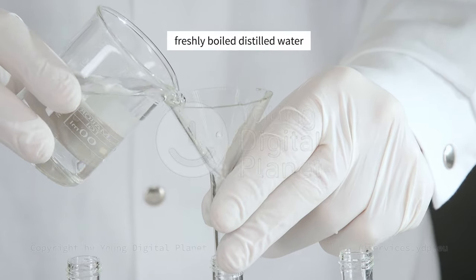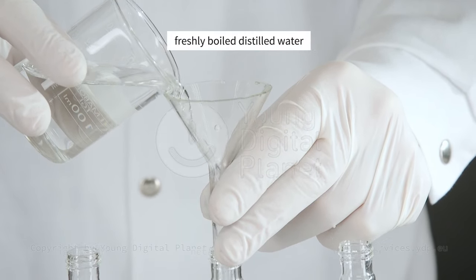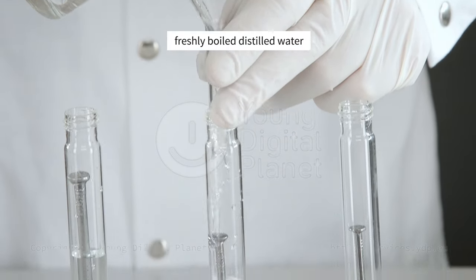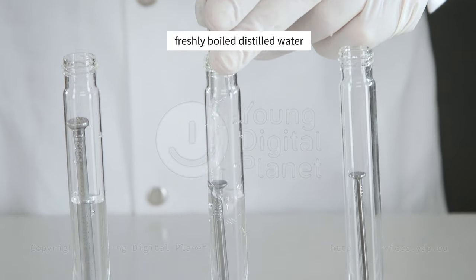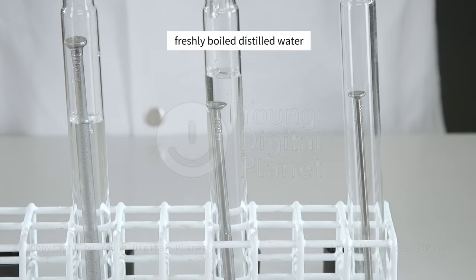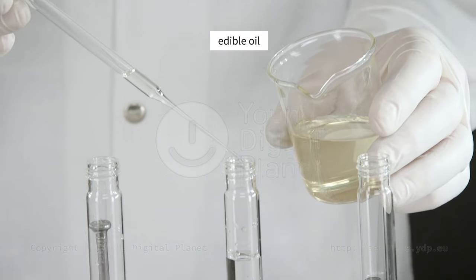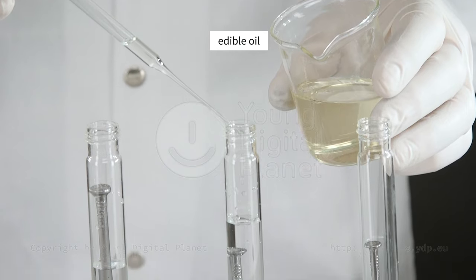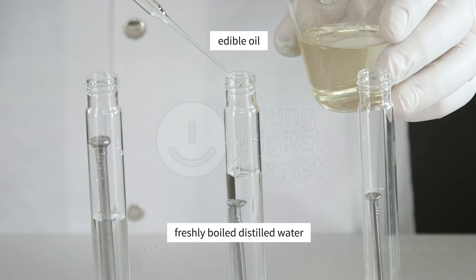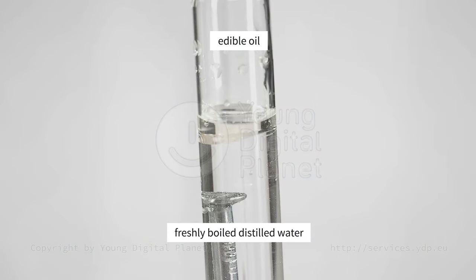We add freshly boiled distilled water — it contains less dissolved gases from the air — and a little edible oil to the third test tube. The layer of oil will prevent the air in the test tube from dissolving in the water.